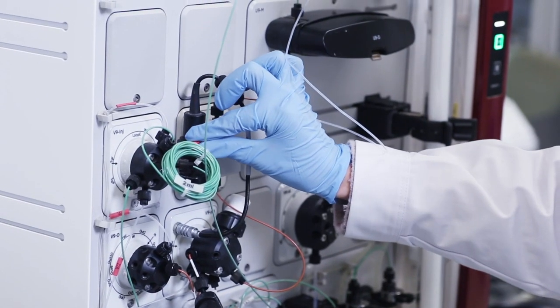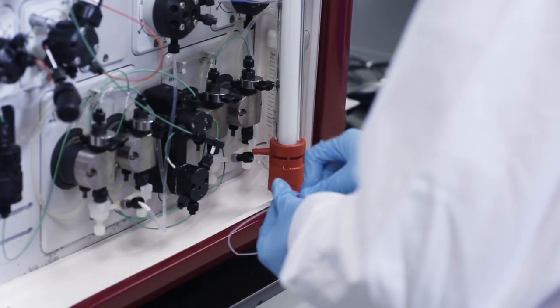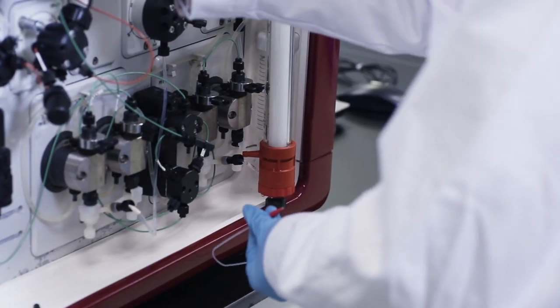Reconnect the pump with a drop-to-drop connection. Open the bottom of the column and run the column to check for any further bed movement. Readjust the adapter if necessary.